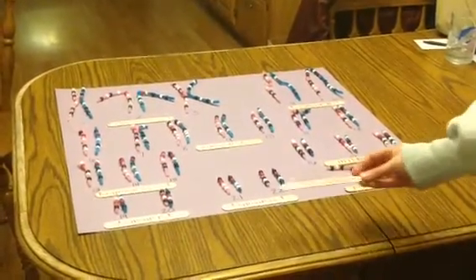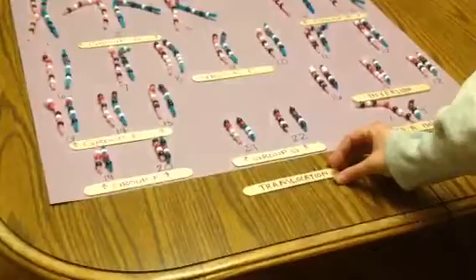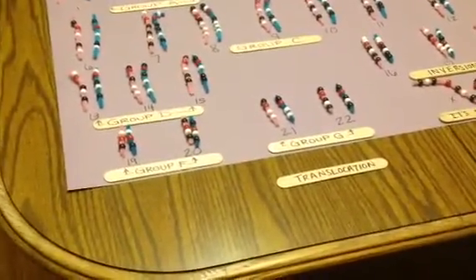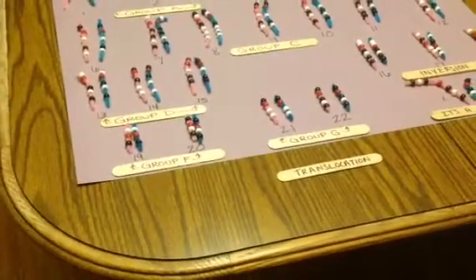Lastly, I'll be demonstrating translocation. Now, there are other structural abnormalities, but today we will just be focusing on these four.